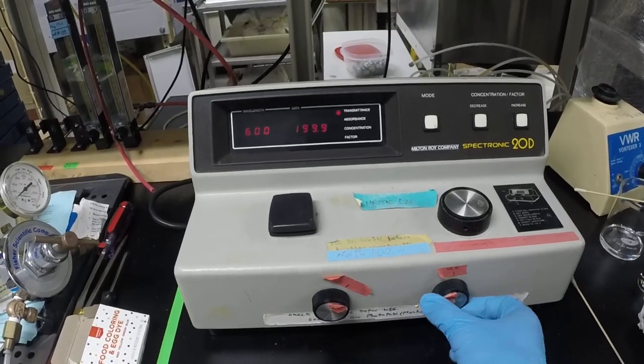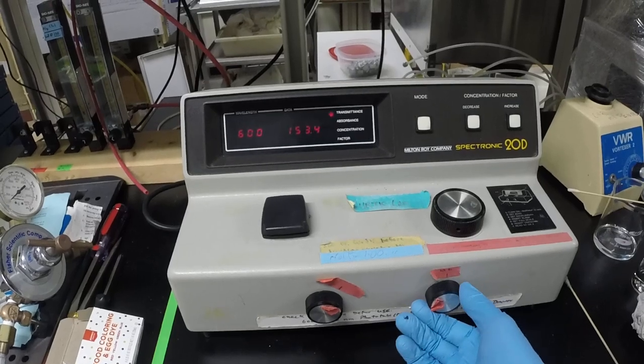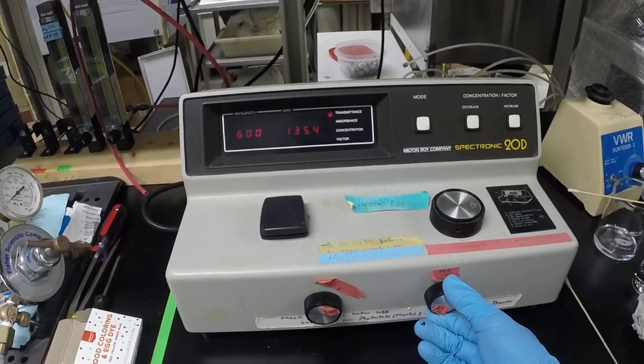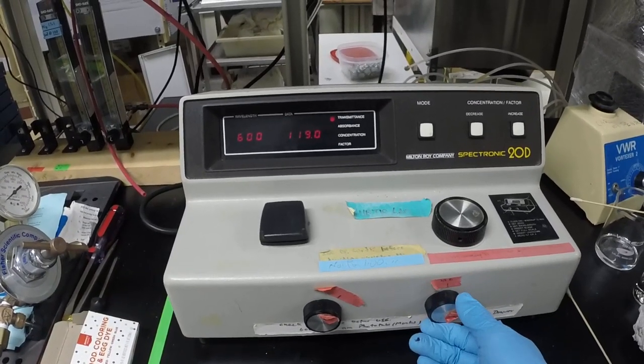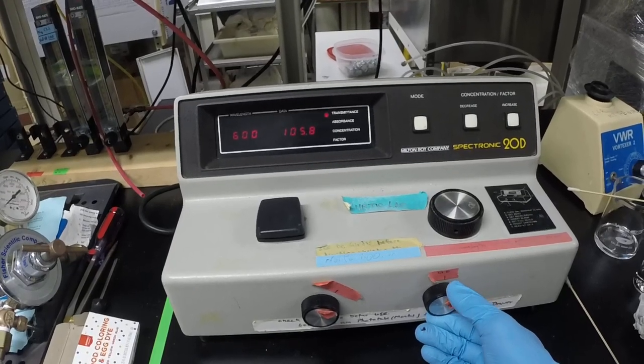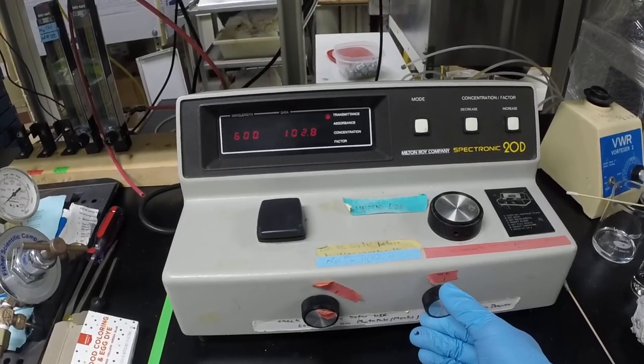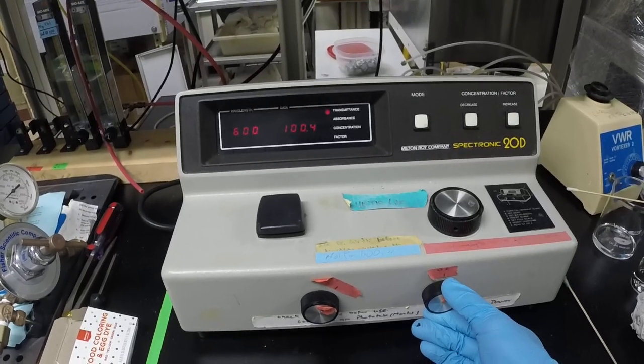I thought it was down. So let's go take it the whole way down. And we're trying to get to the point where now we're running through water sample in that cuvette, and that water sample will then give, it should be a transmittance of 100%, all of the light is passing through.